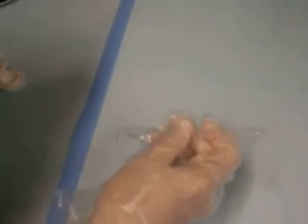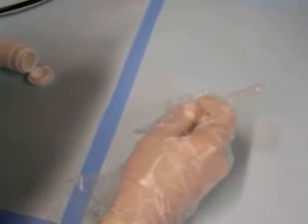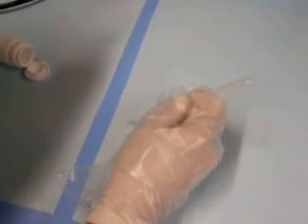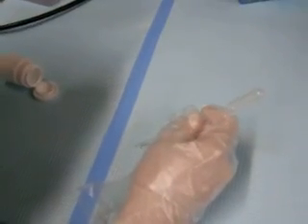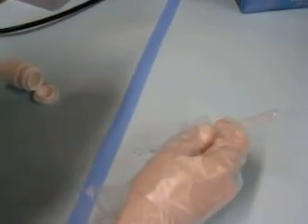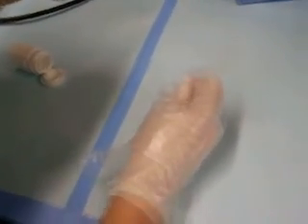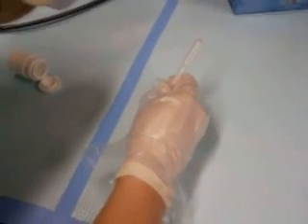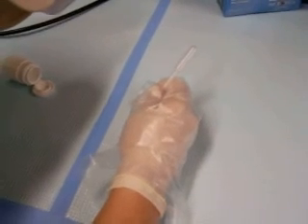How is that proceeding over there? You're sucking. These drops are rather small, and can they be sucked? I think upon complete accumulation and complete agglomeration of the individual beads of mercury, you notice that the beads are actually coalescing. They are. So they are liquid, we believe. Yes. We also, the free energy of mixing appears to be favorable.